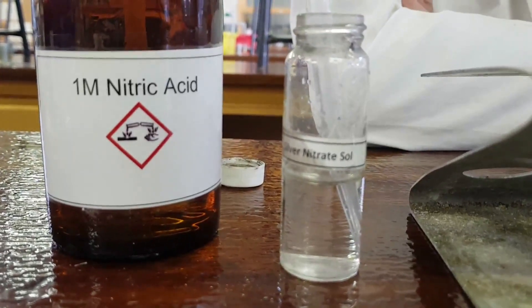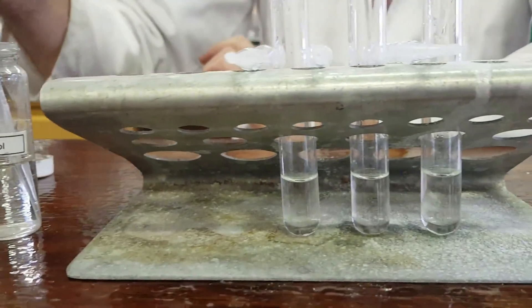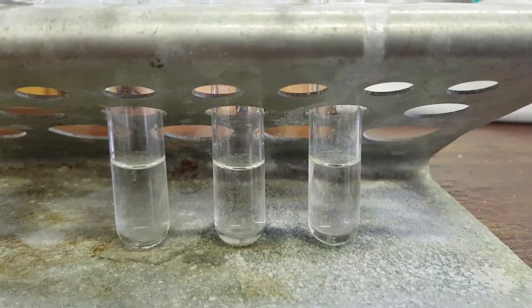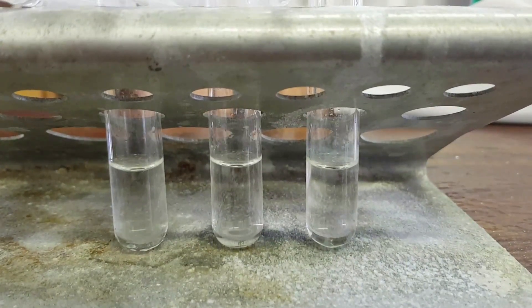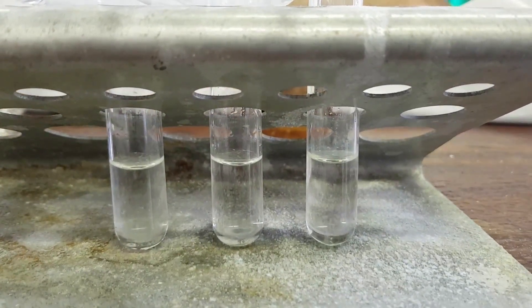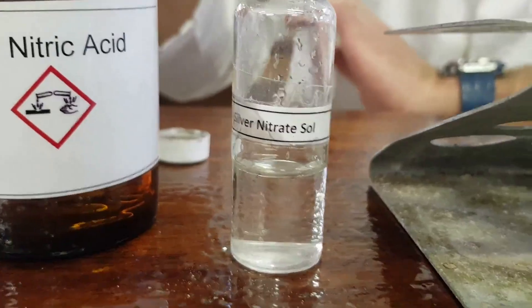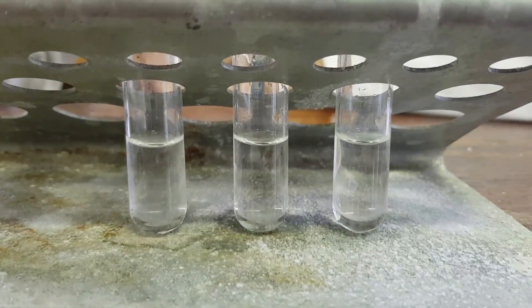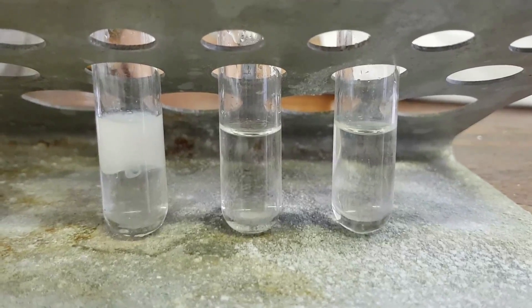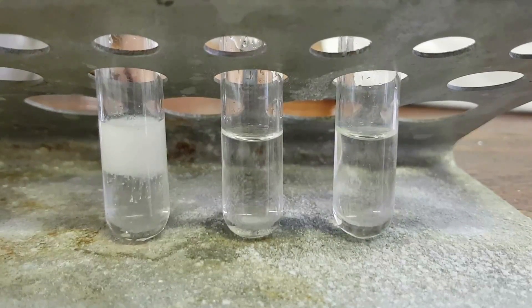We're also adding nitric acid to remove any impurities from the solutions before testing them. Think about why we might use nitric acid rather than other common acids. Mr Reeves is now adding a few drops of silver nitrate solution to each solution, starting with the chloride on the left. We can see a lovely white precipitate formed when silver nitrate is added to potassium chloride.